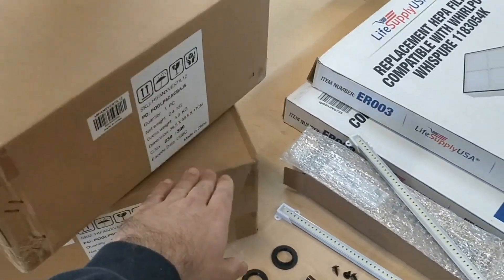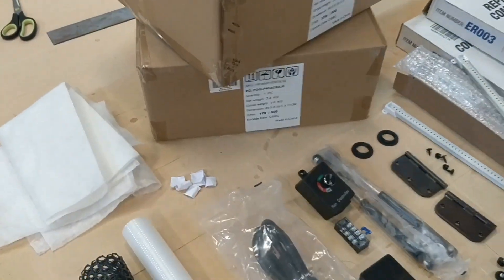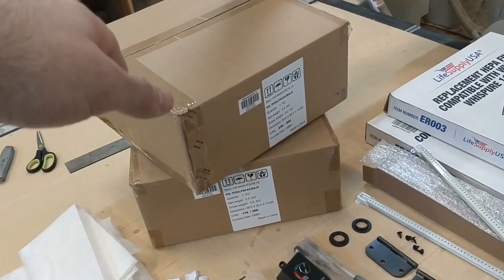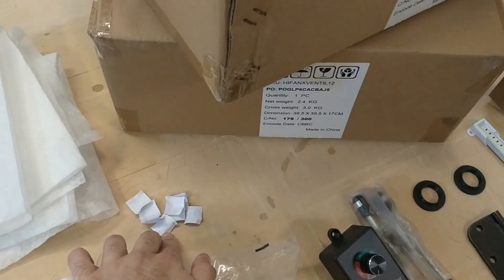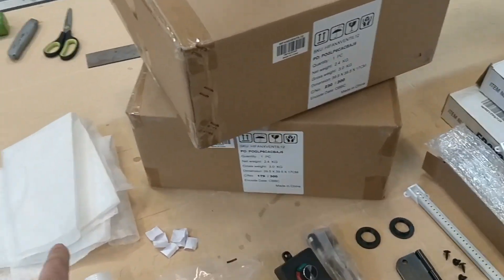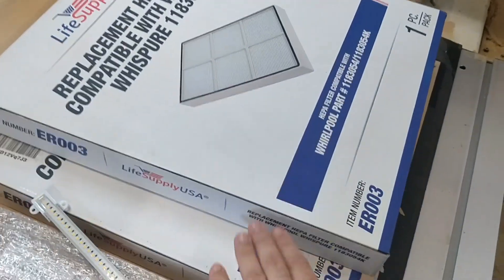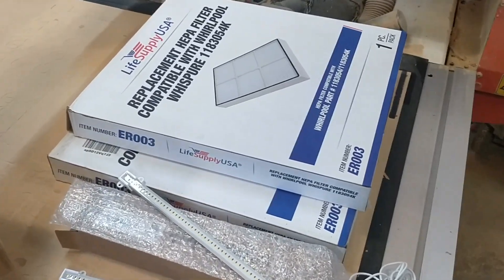To start off, you've got two exhaust fans — that's what's used to force the air through — and you get six intake filters. Those go on top of the exhaust fans and filter the majority of the incoming big particulates. They're just held on by little Velcro tabs on the four corners, which prolongs the life of your filters. You also get two HEPA filters that filter down to 0.3 micron — plenty good for growing plants and mushrooms.